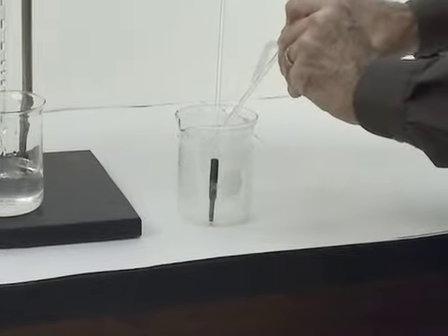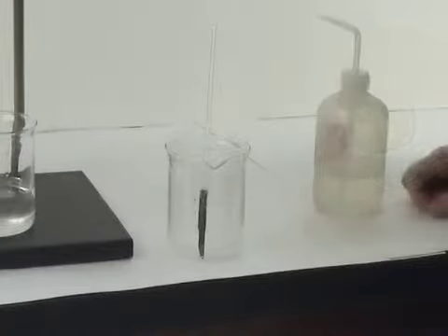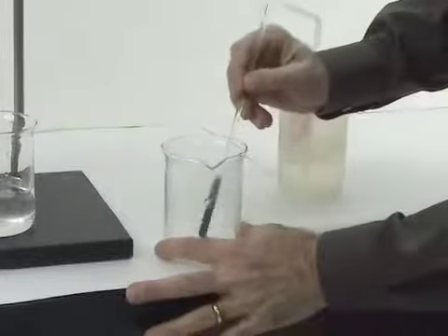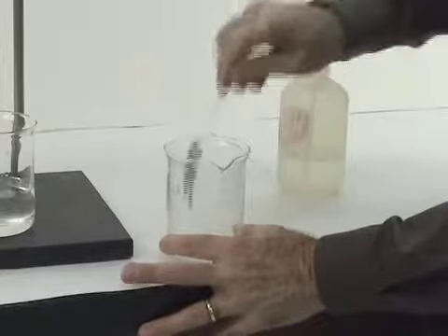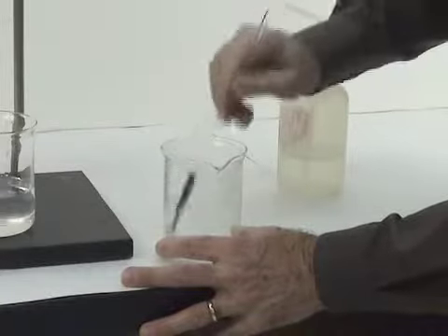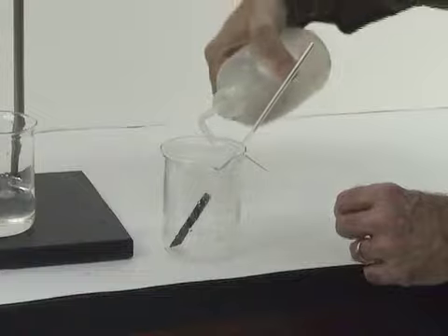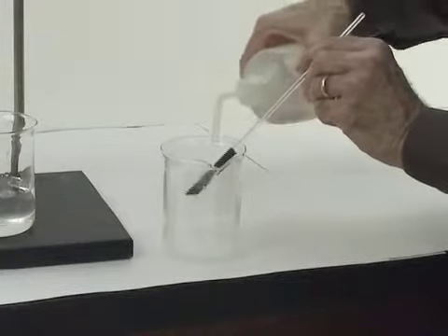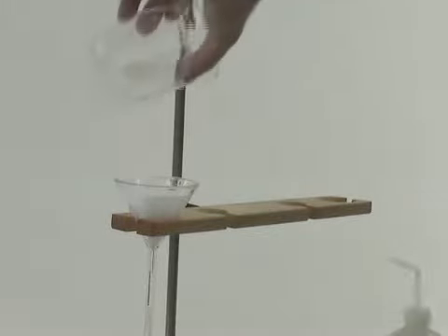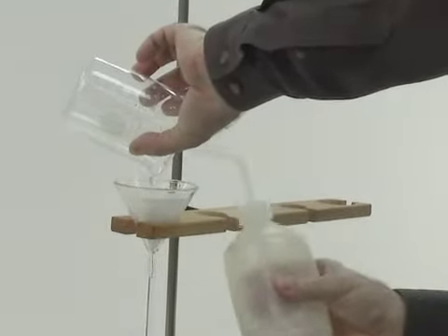Here we first scrape down the sides of the stirring rod, and then we're going to scrape all the inside surfaces of the beaker. This should dislodge any precipitate that is stuck to those inside surfaces. Notice here how we use the wash bottle to rinse the loose precipitate into the filter paper.